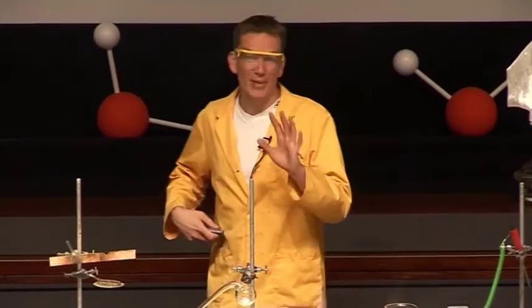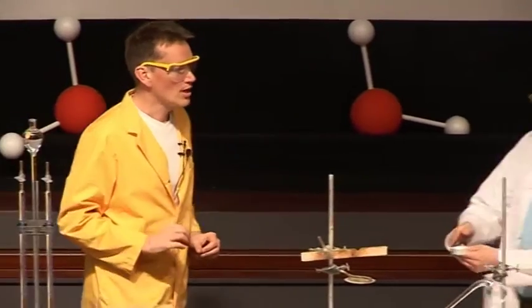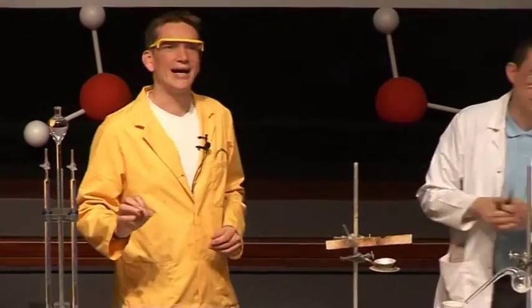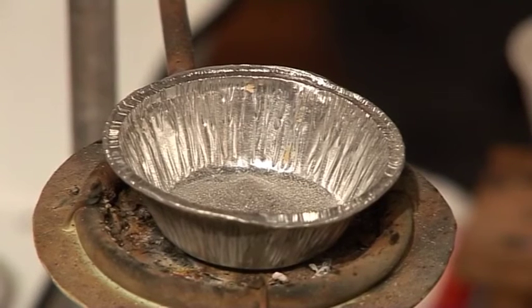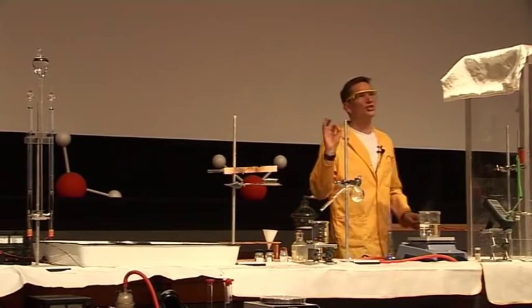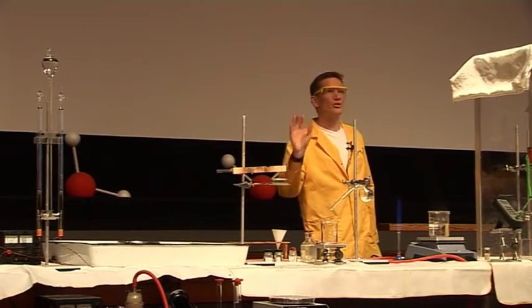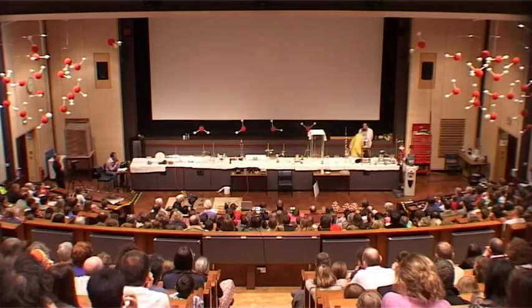I'm going to use the magnesium again, but this time start a reaction using a drop of water. Mark has just brought here a mixture of magnesium powder and silver nitrate. The silver nitrate contains a lot of oxygen, and this oxygen is going to react with the magnesium. I'm going to start this reaction — it seems to be sitting there perfectly happily at the moment — with just a drop of water.